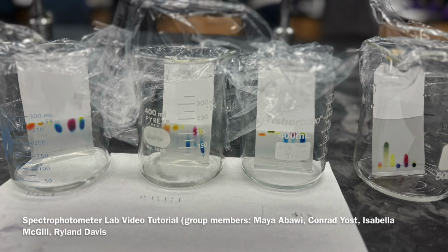So we're going to be using this kind of fancy scientific definition. It basically says that the absorbance of a solution is directly proportional to the concentration of the absorbent substance and the path length of the light through the solution. Now, the equation, I'm going to put it on the screen. A is the absorbance value, epsilon is the molar absorptivity, b is the path length, and c is the concentration.